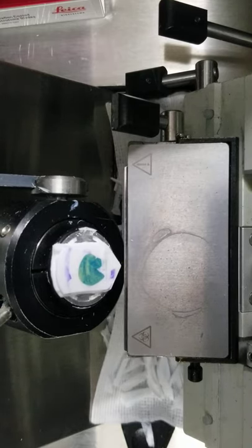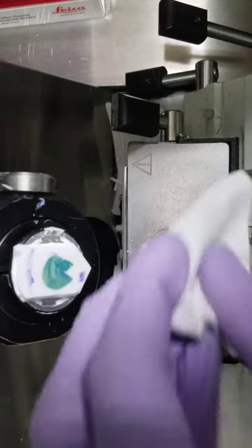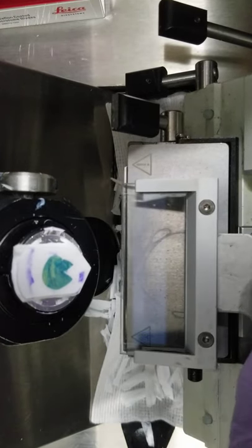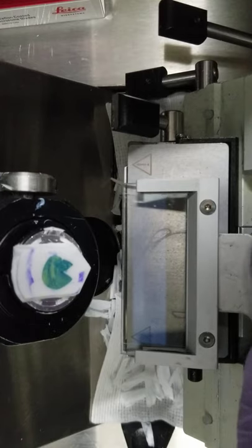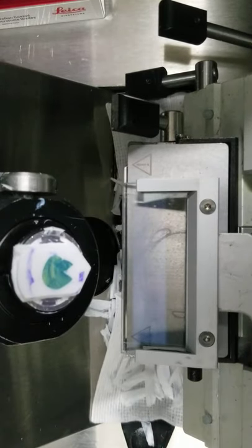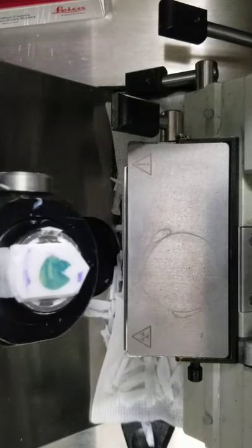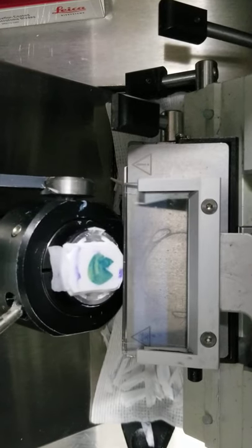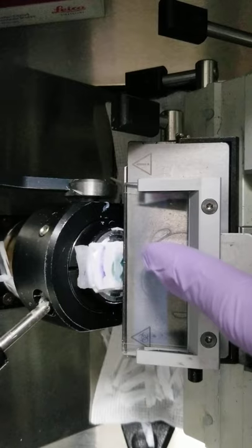That's why, with the first block in the morning, if you're using a roll plate, don't ever cut real fast, because you can break or damage it. Now, if it is too far forward or too far back, actually, just put it right back on perfect. If it's too far back, what you'll get is it will roll up in front.